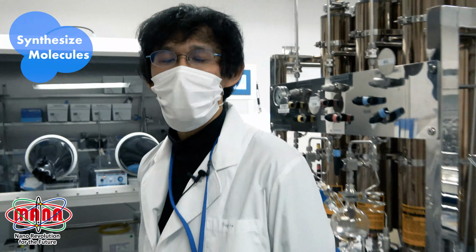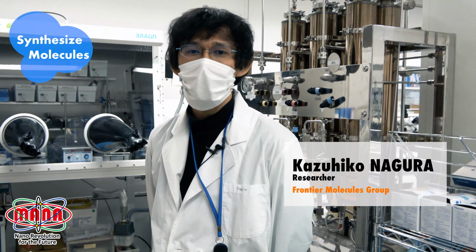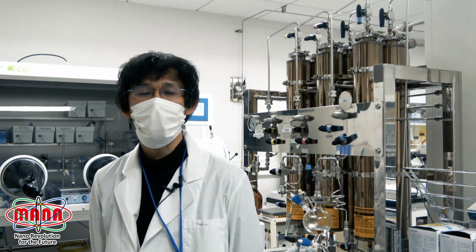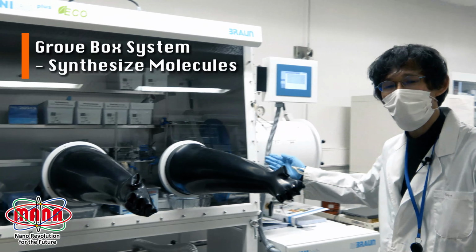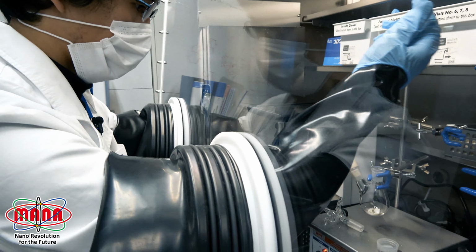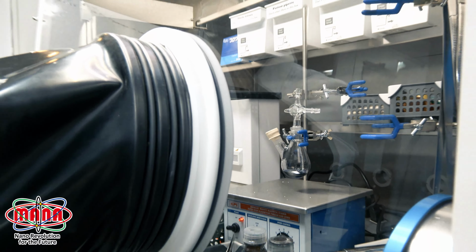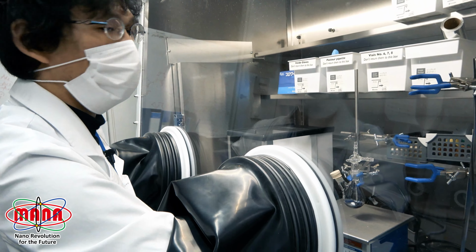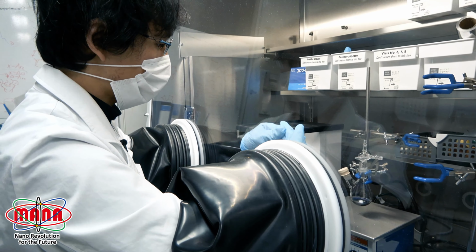So in this lab, we synthesize the molecules by using organic synthetic methods. Usually we perform several multi-step reactions to synthesize our target. For example, we often use such a glove box to prevent air and moisture. After the reaction, we take out a flask from the glove box and purify the product in column chromatography. So let's go to the next experiment.